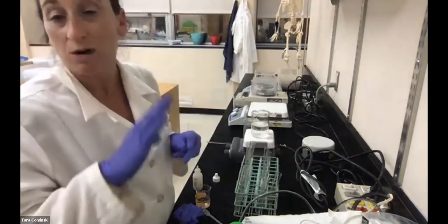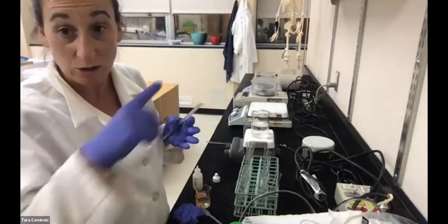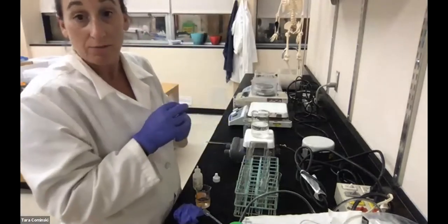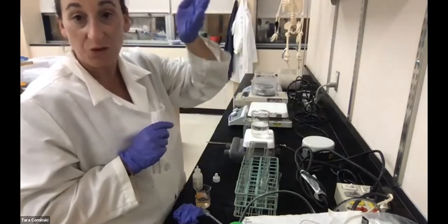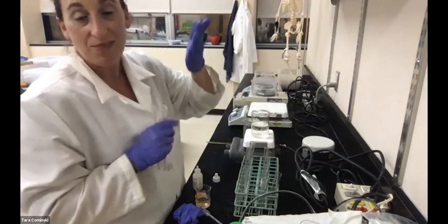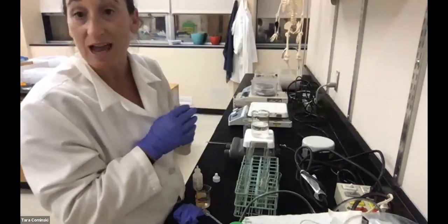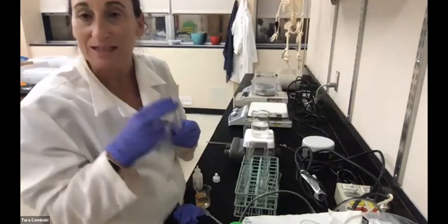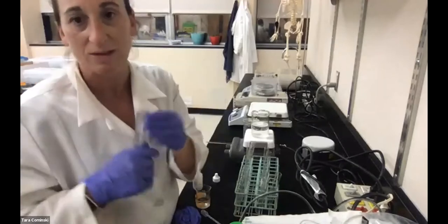So again, we're completing that table. We're also making a graph of this data, so we can see the effect of temperature. It was at 4 degrees Celsius, then 37 degrees Celsius, and then 100 degrees Celsius. How did the enzyme activity change? And again, the enzyme activity is based on the bubble column height, those measurements I gave you.